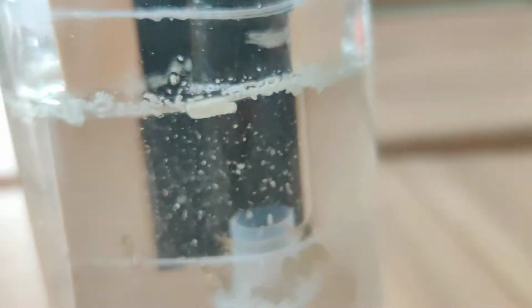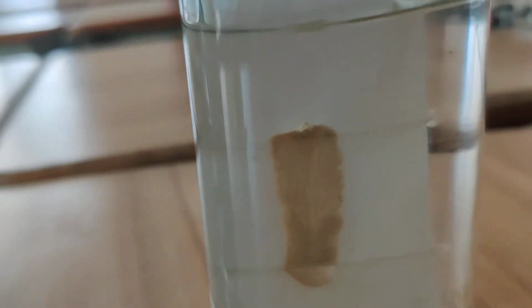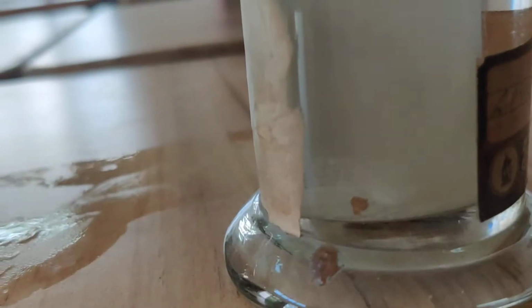This structure is hydra. Can you see? Now another specimen belongs to phylum Platyhelminthes. In Platyhelminthes, this is Fasciola hepatica. It is a flatworm, Fasciola hepatica, or liver fluke. It is a parasite attached to the liver of certain animals.